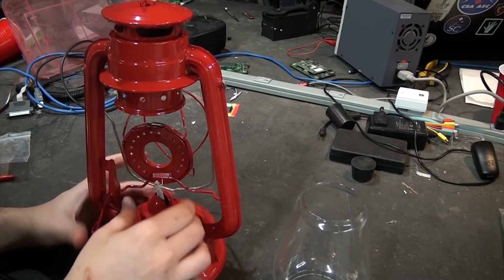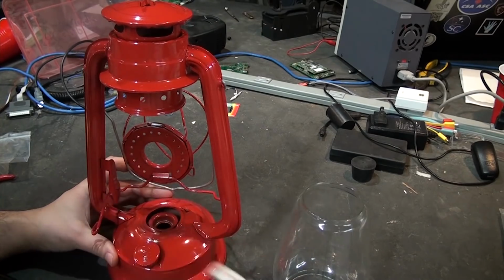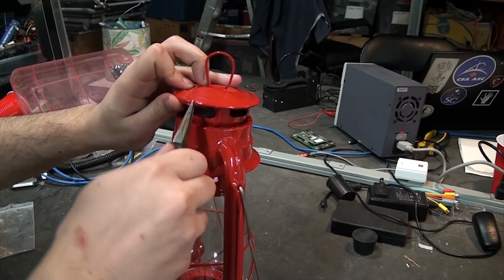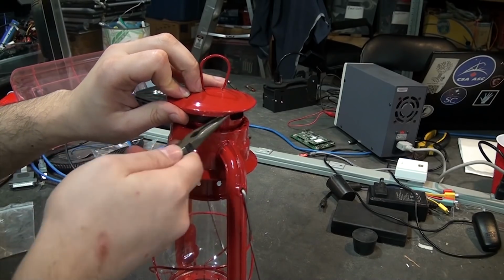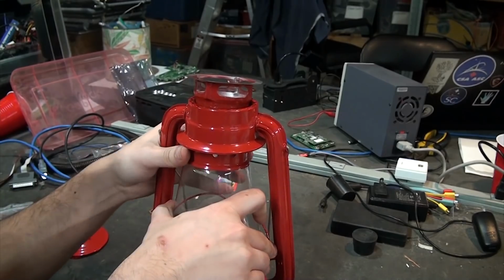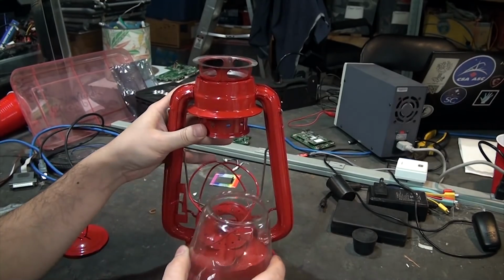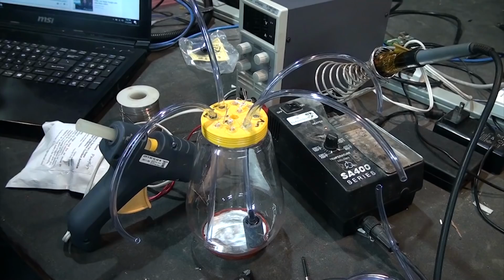First up, the lantern needed to be taken apart to make room for the tubing, air pump, and electronics, as well as to convert the glass piece into the main reactor chamber. After removing the wick assembly and as much of the internal workings as I could, as well as the top lid, I could start working on the main chamber. I removed the glass carefully and started working on a top and bottom for it. The bottom piece will be physically attached to the glass, but the top part will be part of the lantern, so we'll need something that the glass can press onto to seal it.